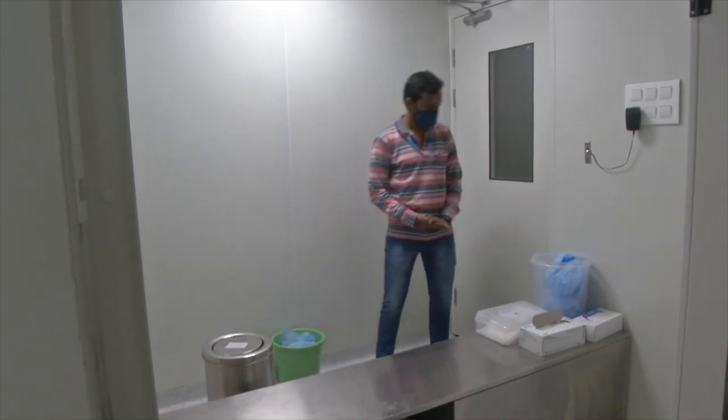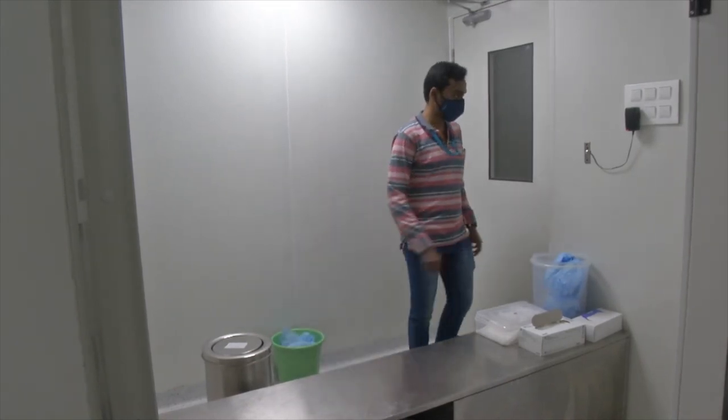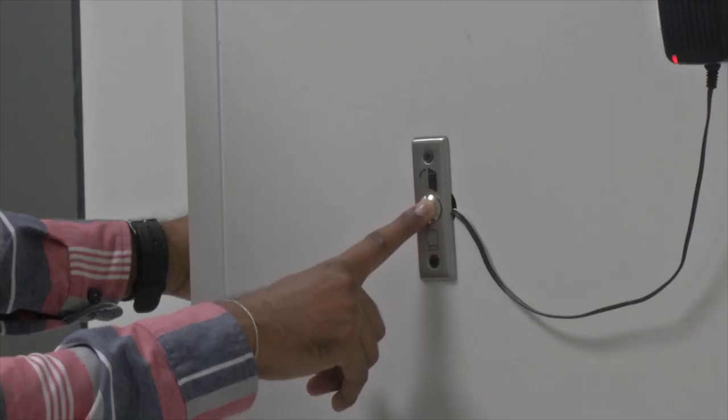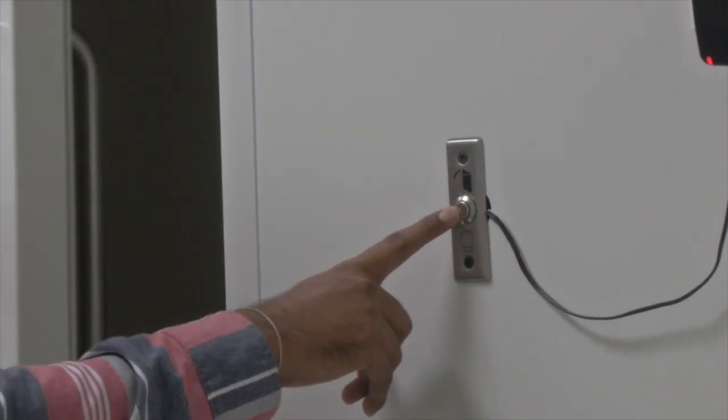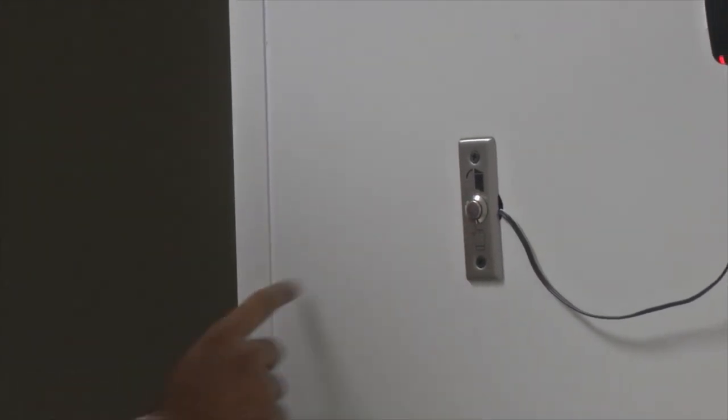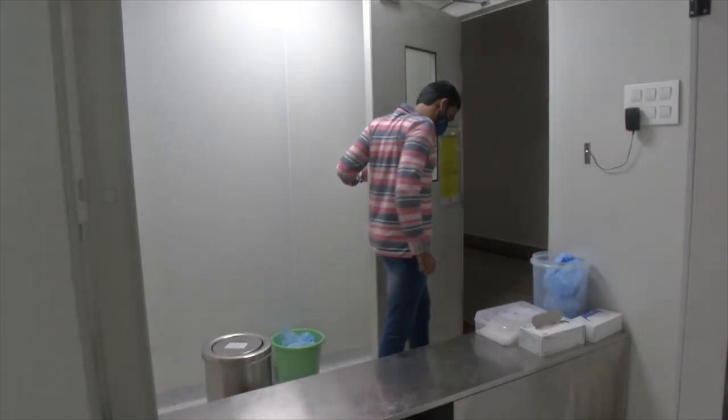The exit of the clean room can be done by pressing the exit button and then closing the door. This is how we can exit a clean room.